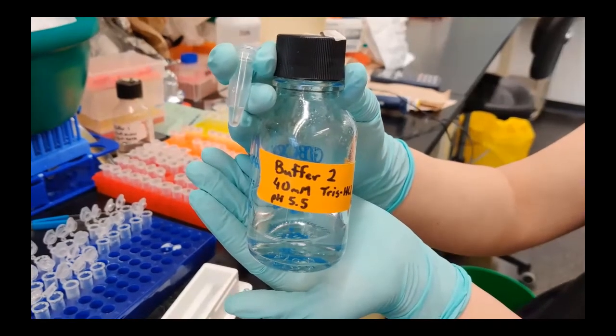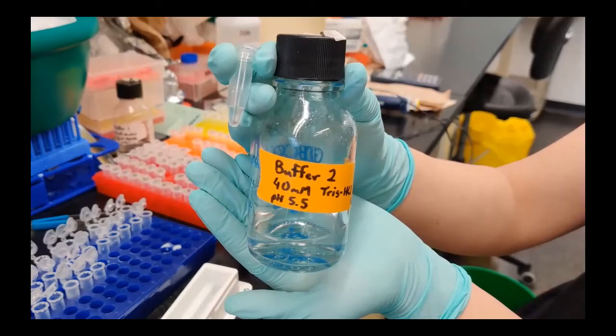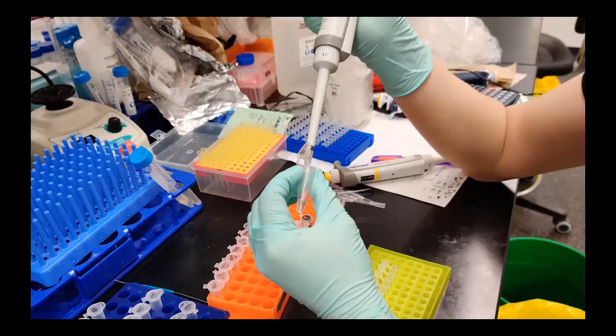Next, we add another chemical to stop the reaction and stabilize the DNA. The DNA is now ready for the next step!